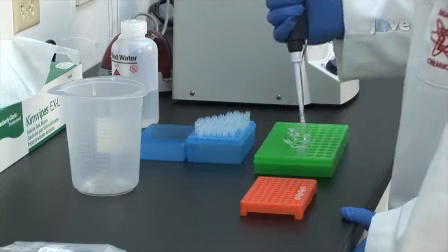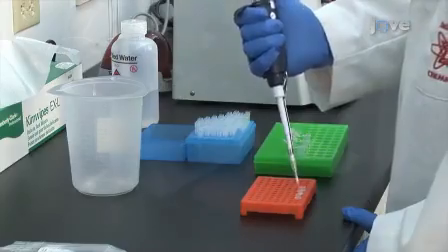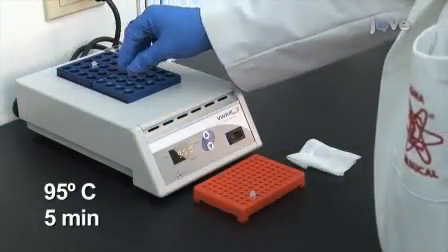To prepare samples for later use, place 100 microliters of each supernatant in a sterile amplification tube and incubate at 95 degrees Celsius for 5 minutes.